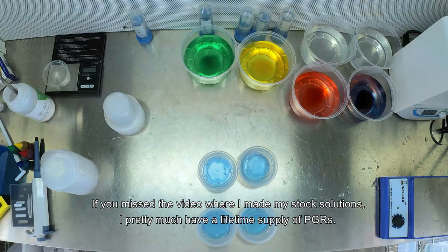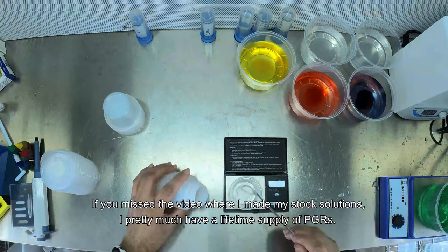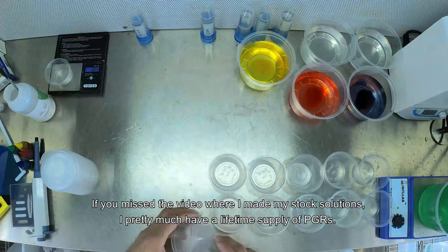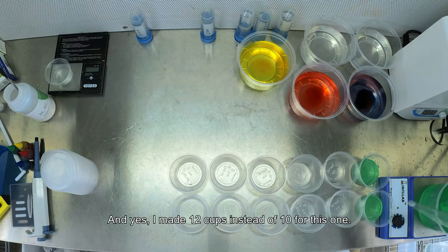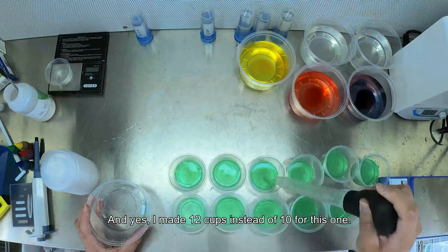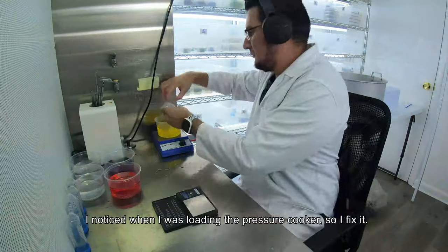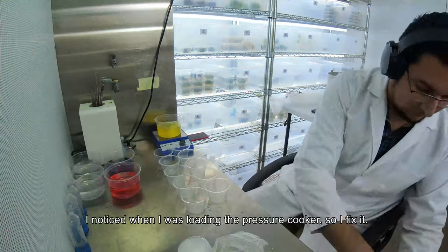If you missed the video where I made the stock solutions, I pretty much have a lifetime supply of PGRs. I noticed I made 12 cups instead of 10 when I was loading the pressure cooker, so I fixed it.